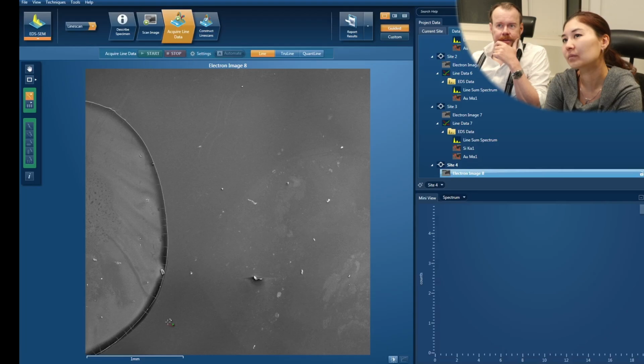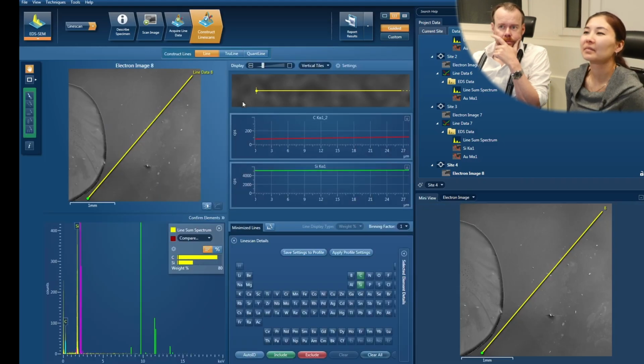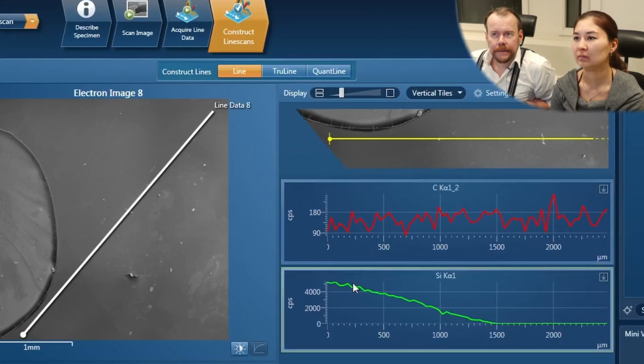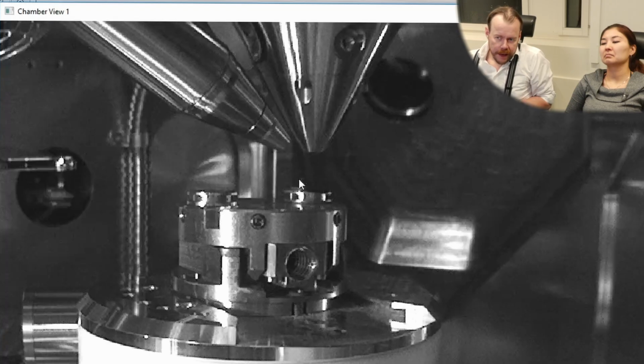So what I want to do now is I want to make a very big line. Here we can see the silicon signal. It's a lot down here. And then when we scan upwards, the signal goes down. Why? Let's look at the geometry. So here is the sample, here is the detector. When we're scanning several millimeters back and forth here, the angle the X-rays are entering the detector becomes so far away that we actually start to lose intensity going into the detector. This is a geometrical error.